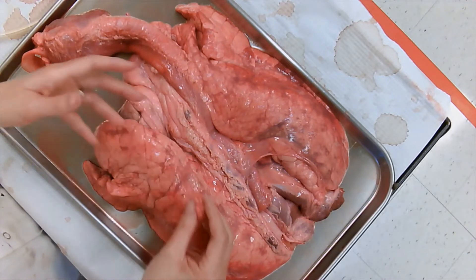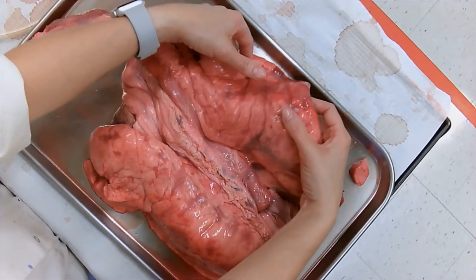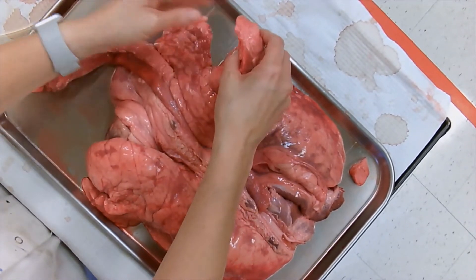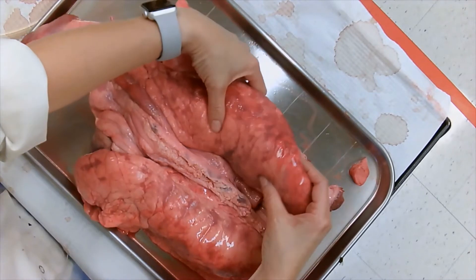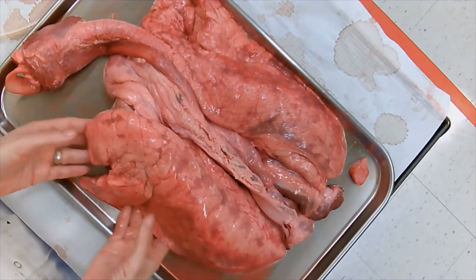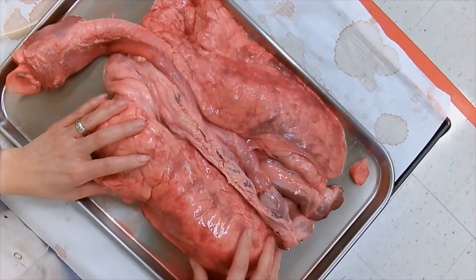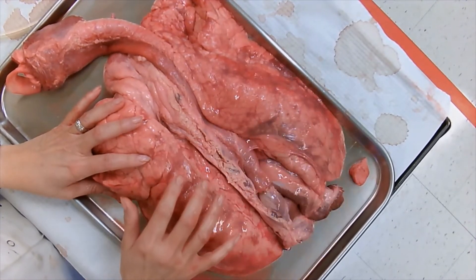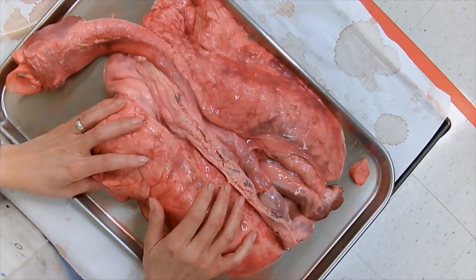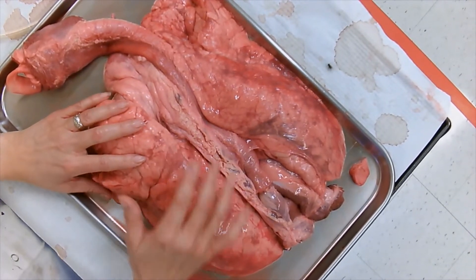Now if we look at the lungs, the lungs have separate lobes. You have a lobe here, a lobe here, and this lobe right here. On this other side I have a huge thick lobe and then a thinner one. Can somebody tell me why this lobe is really big and this one is thinner?